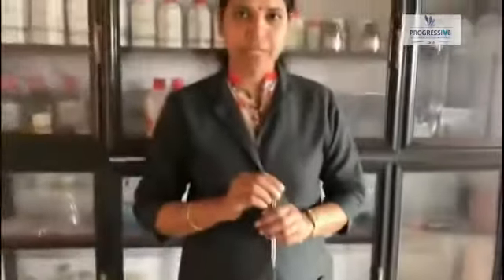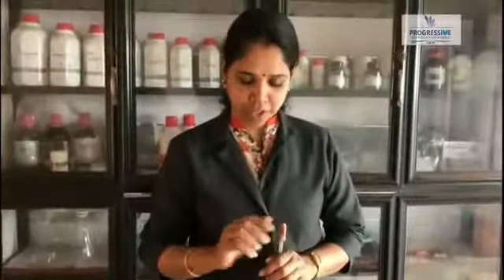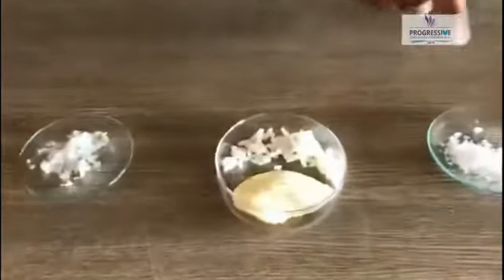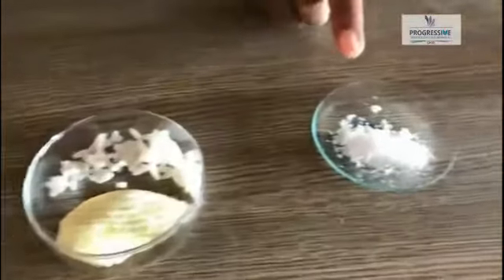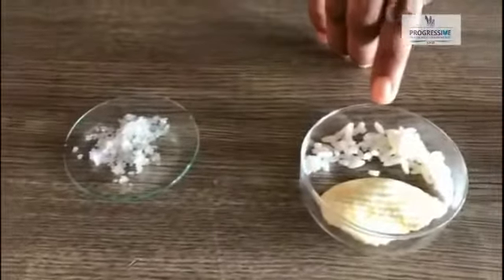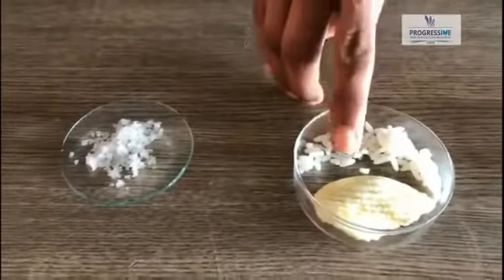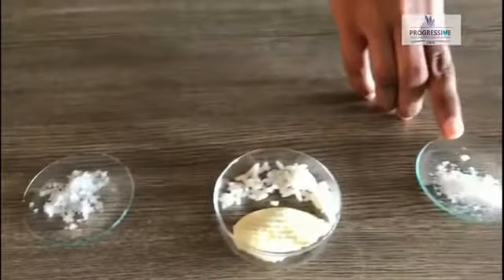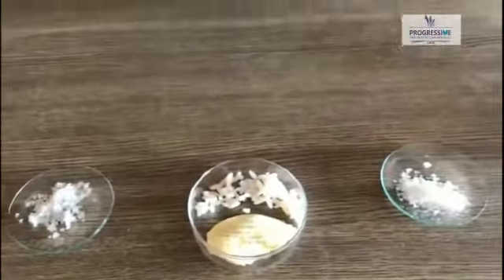So now we are going to test the presence of starch. We have some food materials here. We have sugar, some rice, some potato chips, and we have the salt.